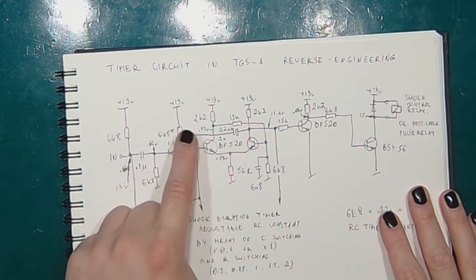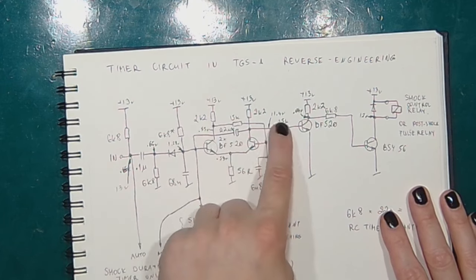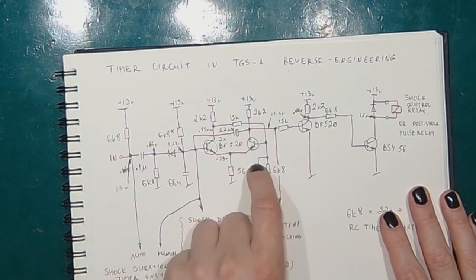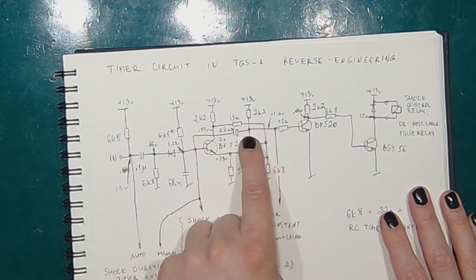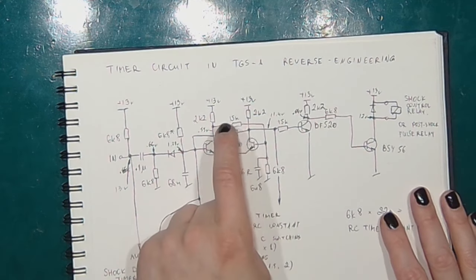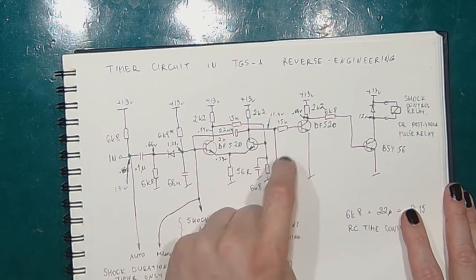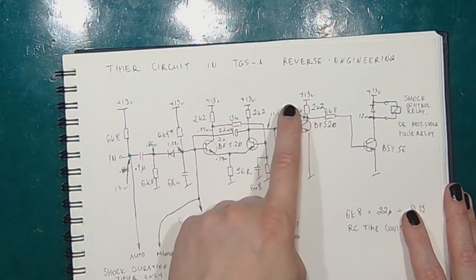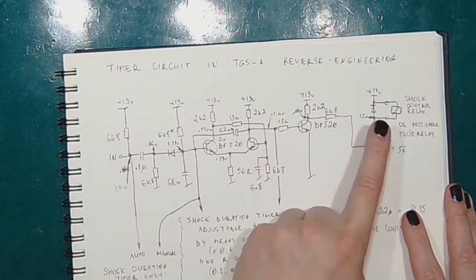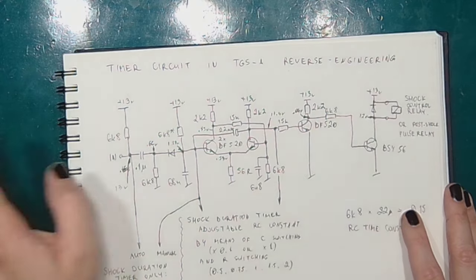When pulling down the base of the transistor, the collector goes high, and the base of the other transistor will go high. This transistor will start conducting, and the base of this transistor will go low. This is an inverter, so the collector will go high, putting the current through the base of this transistor and switching the relay on.